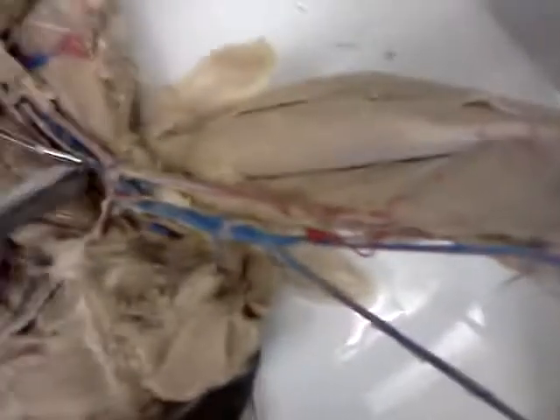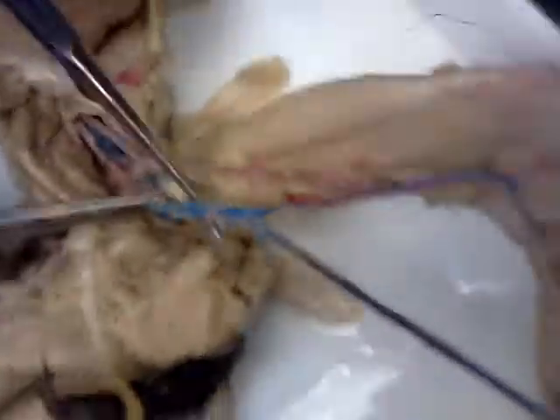So after that branch, external is where? External is the fat guy. Internal is the skinny guy. And the external turns into the... External after the branch point becomes the femoral. After the femoral, you have the great saphenous. Now, if I had one, my popliteal would be over here, traveling deep into the knee, but I don't have one. So, that takes care of the veins.